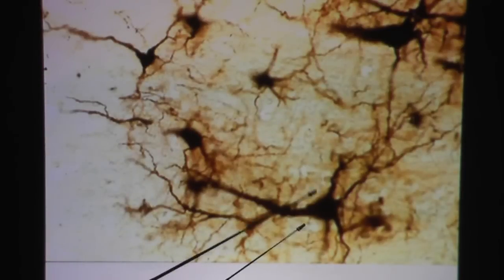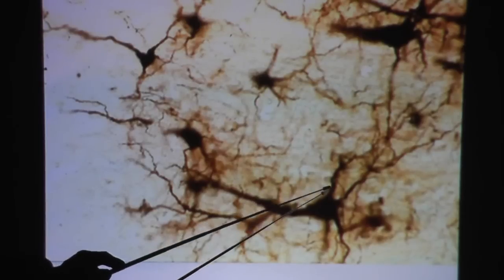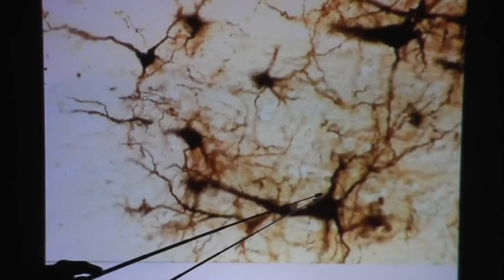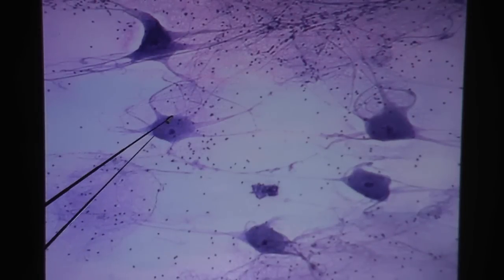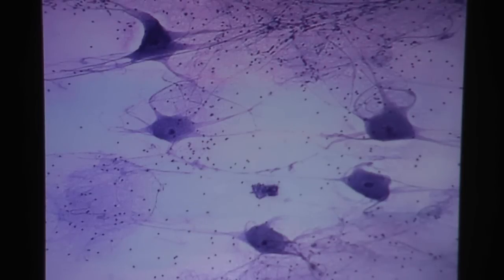Another view of neurons — believe it or not, these are neurons. They look kind of like silhouettes, but you can see they look odd with all of these lines. For these neurons here, this is probably the axon because it's the longest, whereas everything else is probably dendrites. Another look at neurons — kind of odd looking, with all these long processes. More neurons — notice the great nucleolus with the halo effect; that would be the nucleus. You can see the processes for these neurons pretty clearly, as well as the dots for the neuroglial cells' nuclei. And that's it — very quickly, thank you.